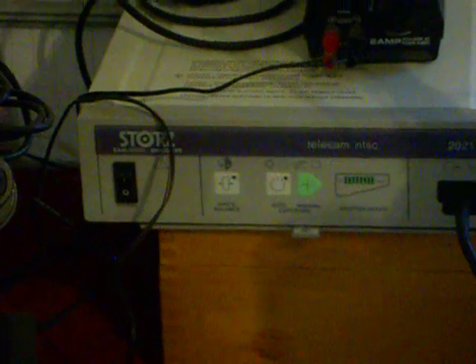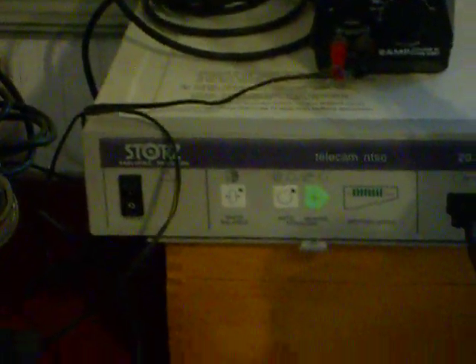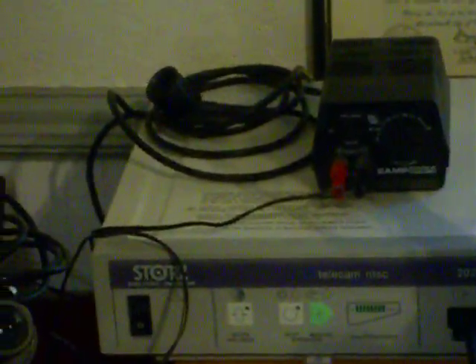I was able to take photos through my standard light microscope, but this was analog, and I had to go through a digital converter and get digital software, and it turned out to be, when I got the new operating system, Windows 7, impossible to use. So I went all digital. Both cameras can be hooked up directly to a USB port. Very convenient, and really I think under $100 per camera, so not bad.